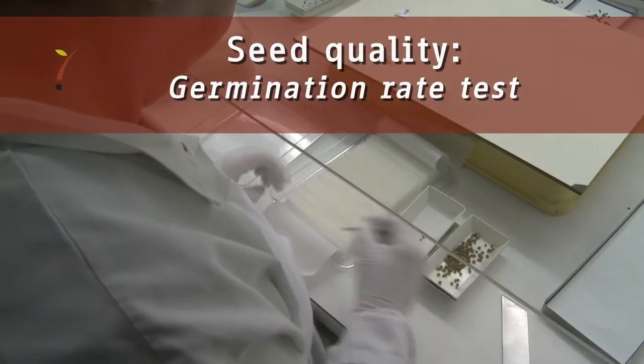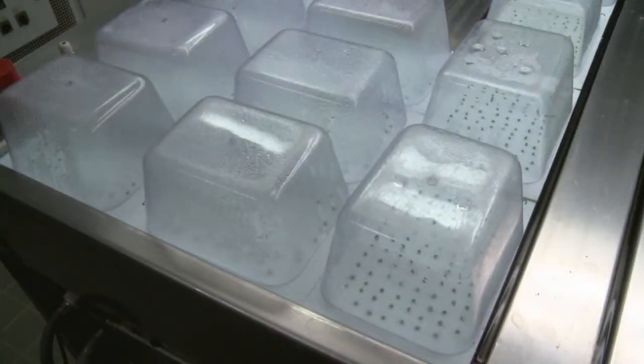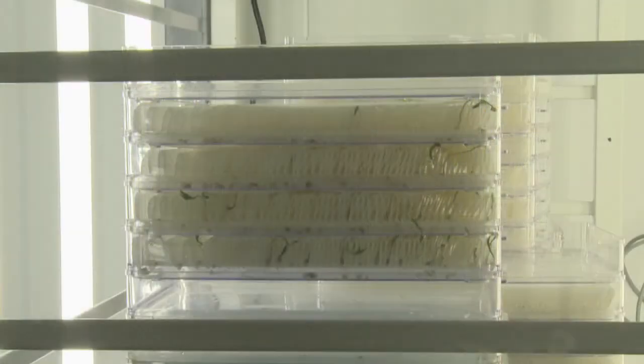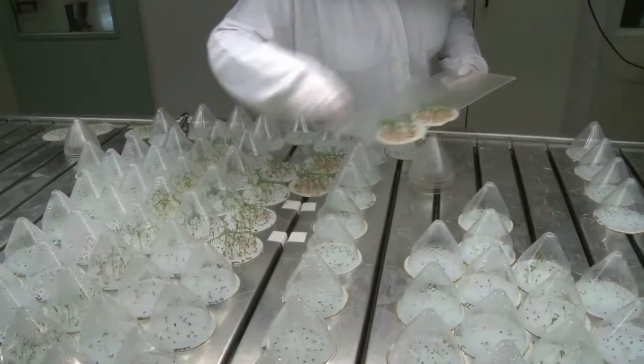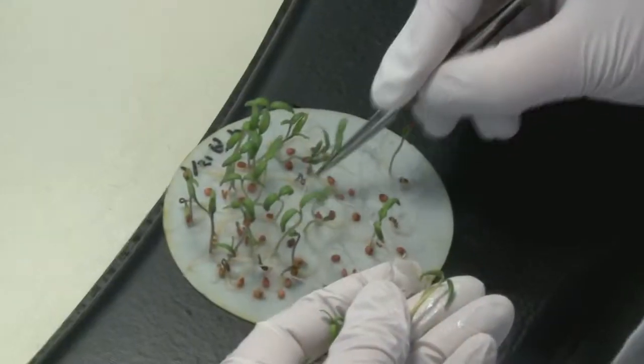In germination rate testing, Naktuinbouw examines the percentage of seeds that produce a complete seedling after a certain number of days spent on a germination table or in a germination cabinet under perfect growing conditions. Naktuinbouw is accredited by the International Seed Testing Association to perform the purity determination and germination rate test and is able to issue the international ISTA certificates.